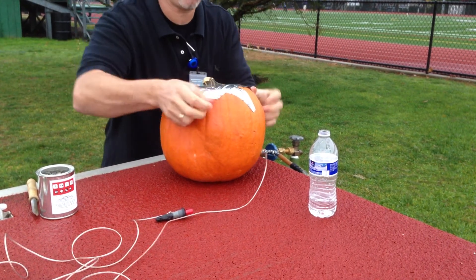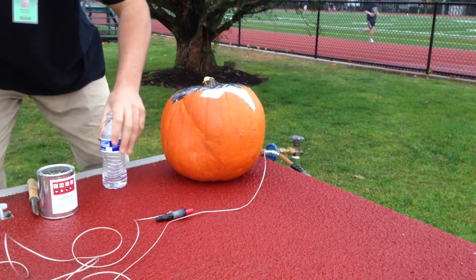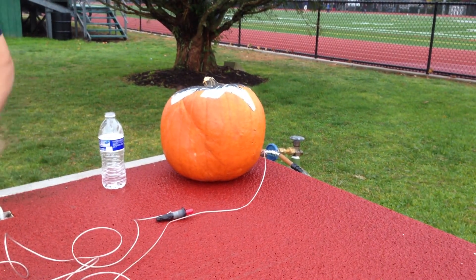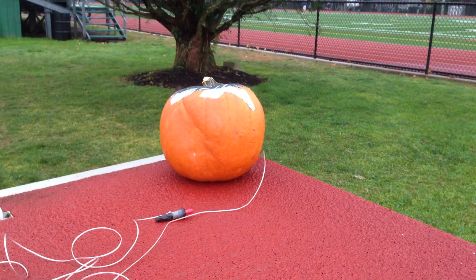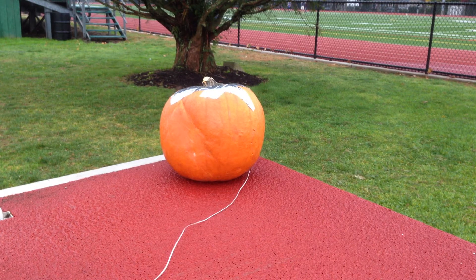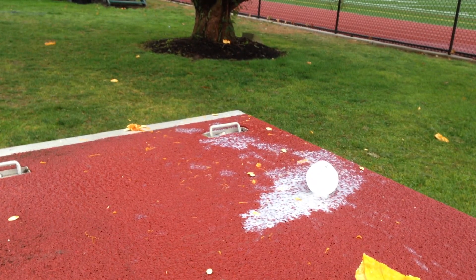I just don't want to blow the top off — let's see what happens, we're ready to go live. We are hot now and I'm going to ignite this. All right, here we go — one, two, three. I couldn't have been any better!